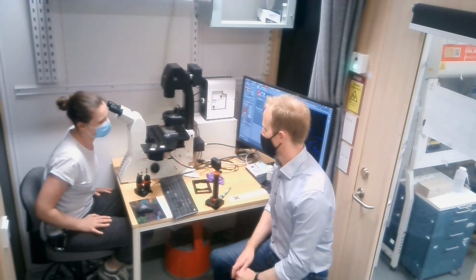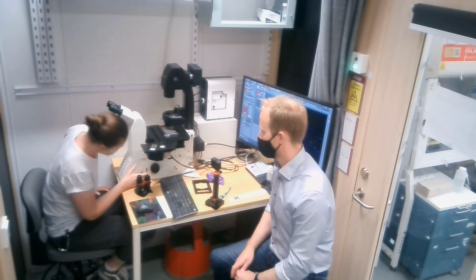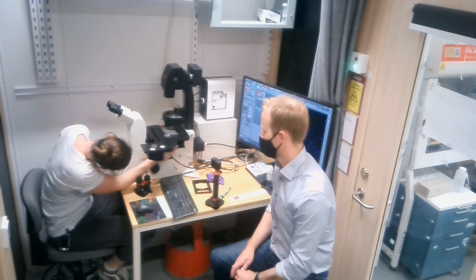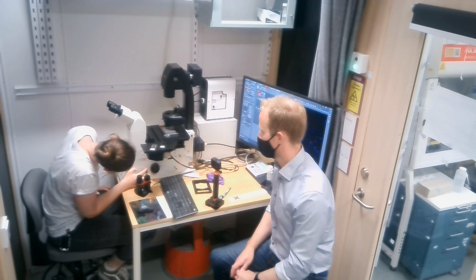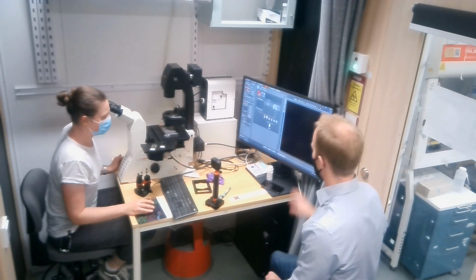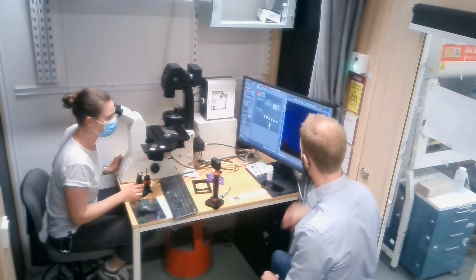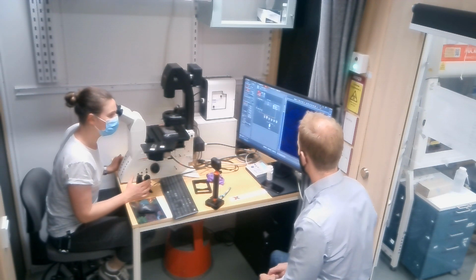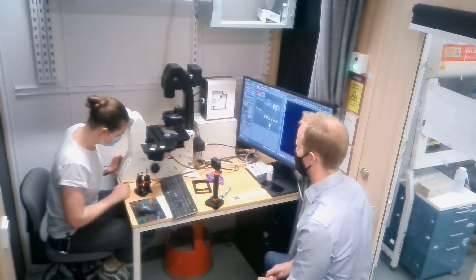So now if you wanted to go to the 5x objective, I would have to go down here. I would go down with that one. You just press and hold, and you go to the 5x. And then you press it up. Yeah, press and hold. Okay, and now I can go live again. Now if you go live, you can press that little automatic one there. There you have it, and here you can see the edge of the well holes. Okay. So this one is really full. For example, if I would want to change my well now, I could go.